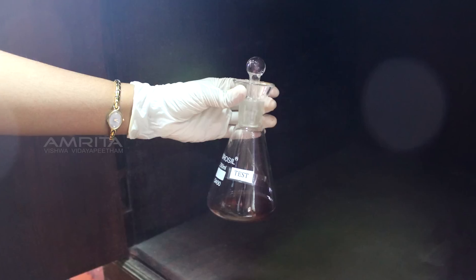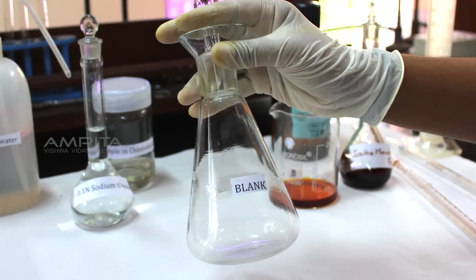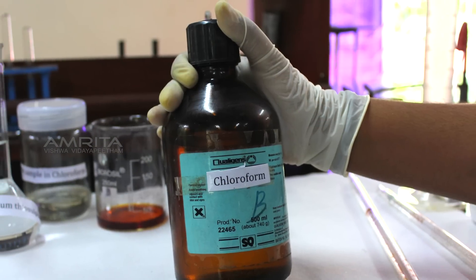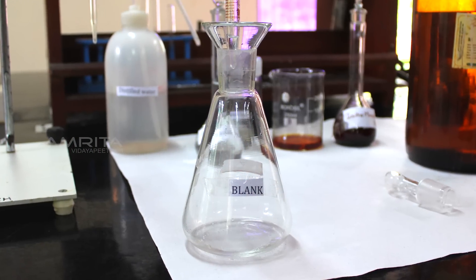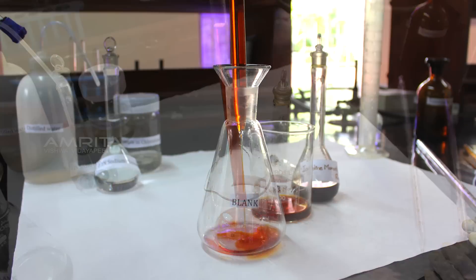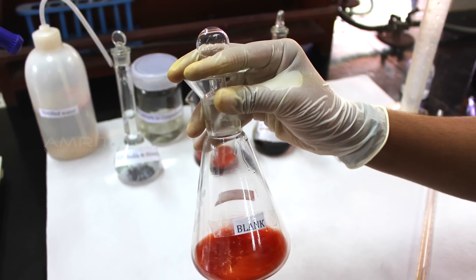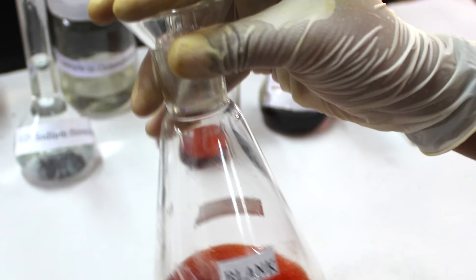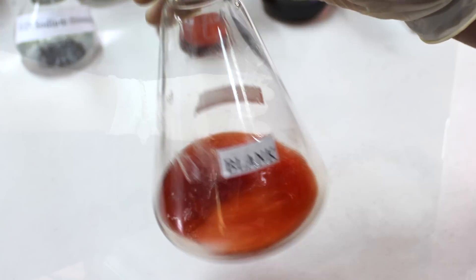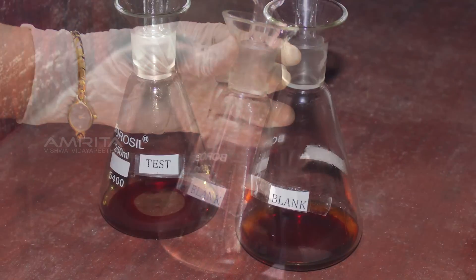This flask is then kept in the dark for incubation at room temperature for 30 minutes. Meanwhile, prepare the blank sample by pipetting out 10 ml chloroform into an iodination flask labelled blank. Pipette out 20 ml iodine monochloride reagent into the flask labelled blank. Stopper the iodination flask and swirl it to mix the contents. The flask labelled blank is then kept in the dark for incubation at room temperature for 30 minutes.